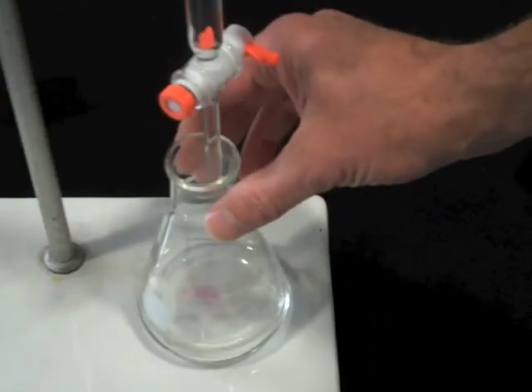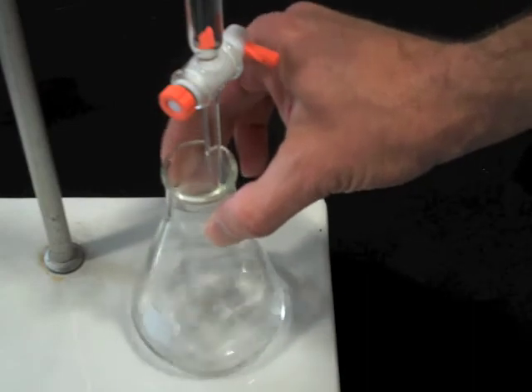We begin adding titrant. If we have a good idea roughly where the end of the titration will occur, then we can save some time by running the titrant into the flask to within a milliliter or two of the expected endpoint. It is common practice to run multiple trials with portions of the same sample. So, it is a good strategy to run one trial very quickly, really to find out where the approximate endpoint is. The next few trials can be done carefully from a point very close to the end. The first trial does not need to be averaged with the more carefully obtained data.